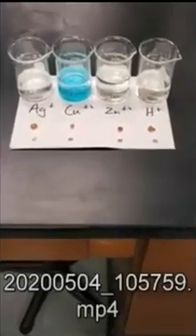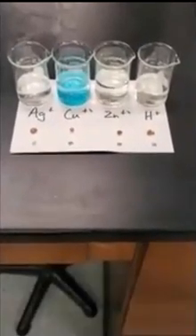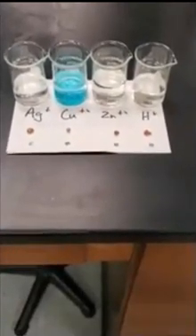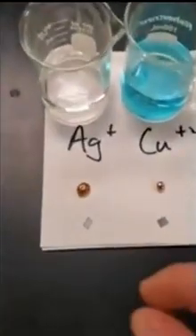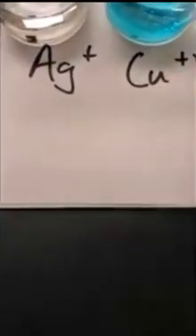So here's a demonstration. I have a solution of silver ion, silver nitrate, so far left, and we have copper 2, zinc, and then hydrochloric acid. And I have two metals: copper metal, which is the orangish looking metal, and then zinc, which is kind of grayish. So I'm going to put both metals in each of the solutions, and then we'll look for the noticeable difference. Too, I'll try to keep them separated from one another.